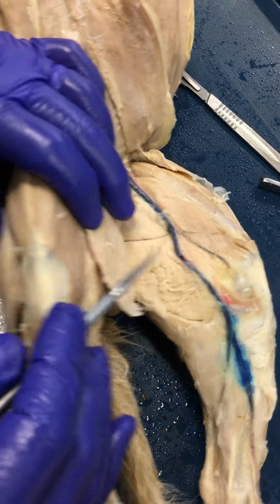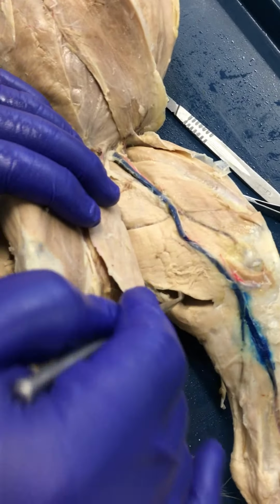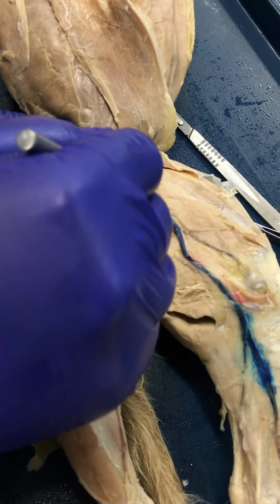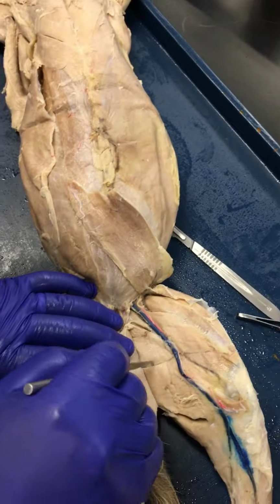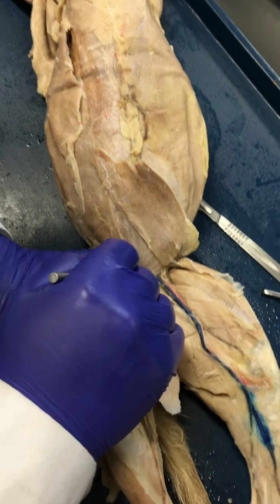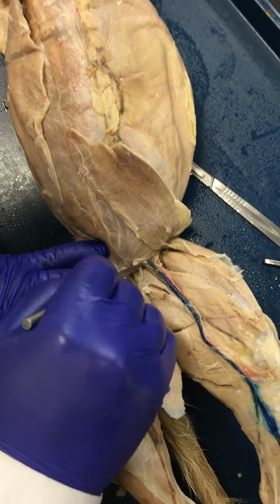As we go deep to the gracilis, on the cats, you do see some hamstring muscles here, which would not typically be visible in the human from this view. So for now, we're going to disregard these. And we're going to make our way to these muscles up here, which are the adductor femoris, which is this big triangular muscle that you're seeing here. The adductor longus, and then deep to that, the pectineus.